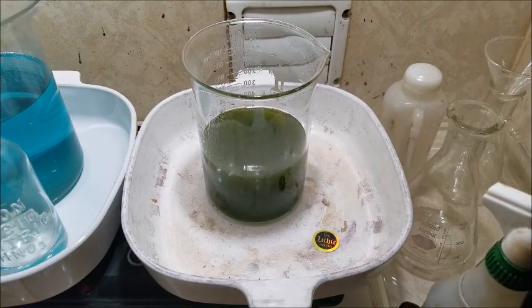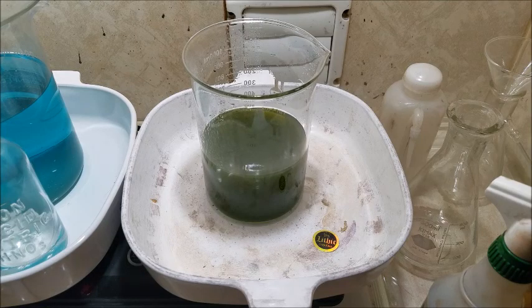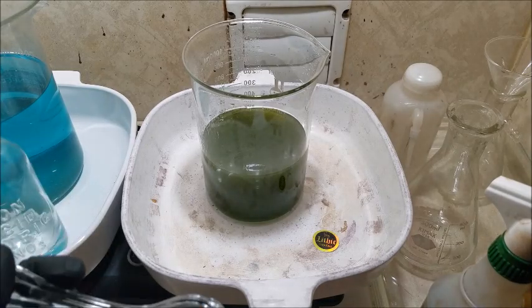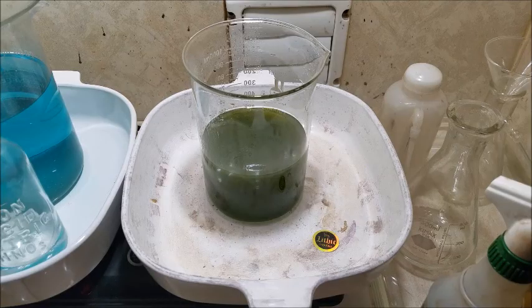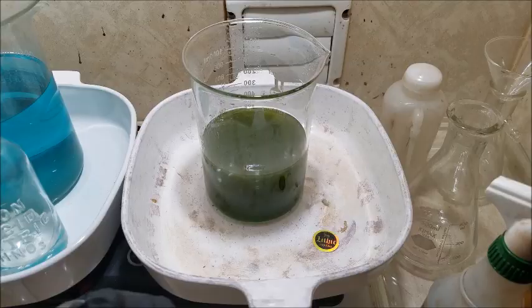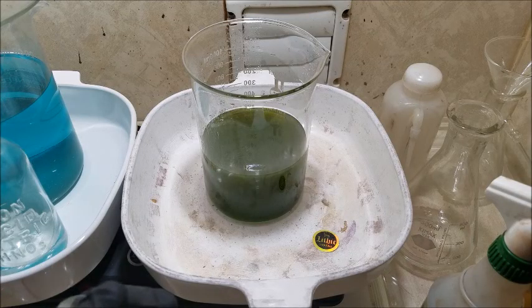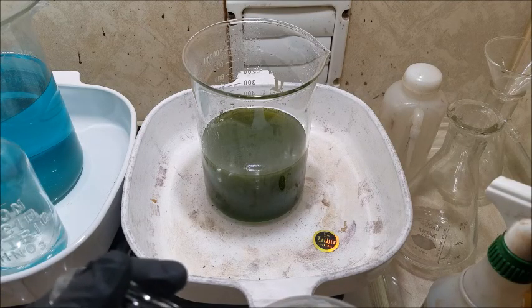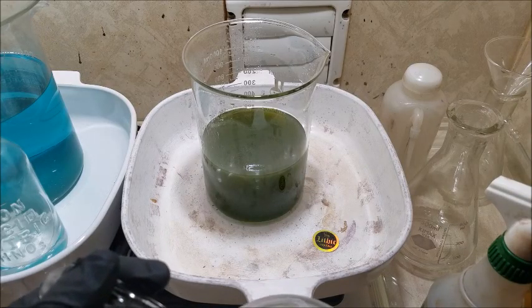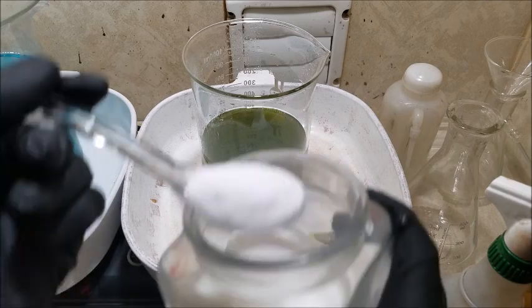Well, I think we're at a point now where it's just, let's drop some SMB in here and see if we can get some gold to precipitate out. I don't know how much free nitric is in there. Man, I think there's going to be a little excess. I didn't go overboard, but I might have for that small amount of material. I just wasn't sure if I had to drop the iron in solution, if it was just going to be the gold and silver and copper from those foils. And let's see what happens.